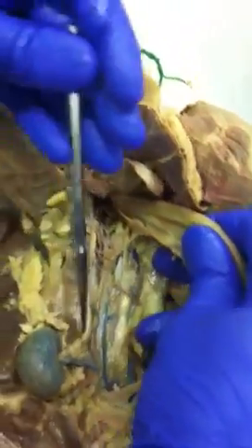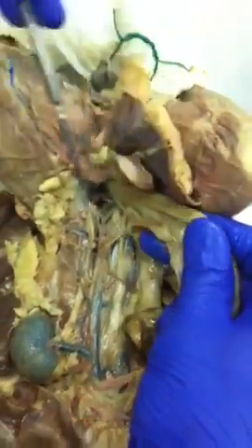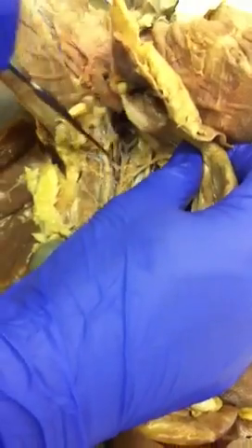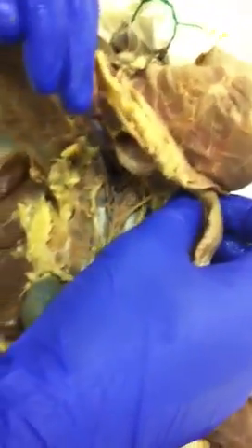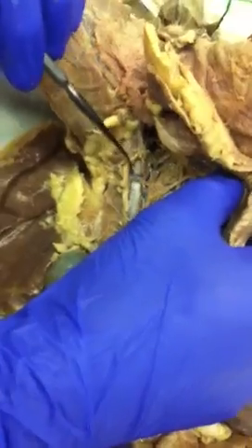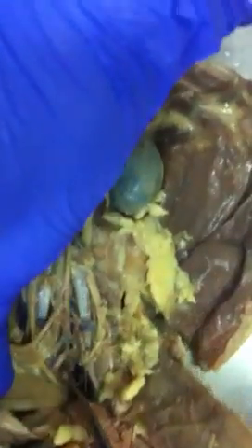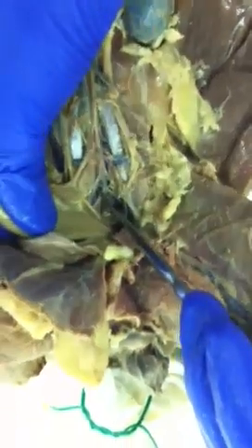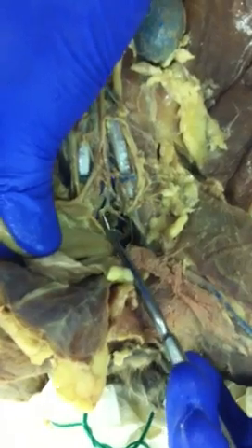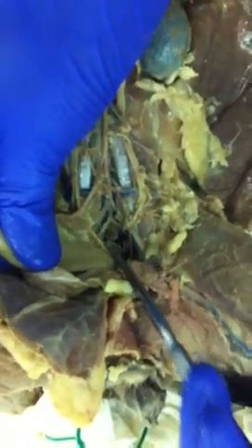Further down, so we had superior mesenteric. This would be inferior mesenteric, a smaller one. Around the lumbar spine, you have iliolumbar, artery and vein on each side. So there's a little bit of red there, and then the blue, both sides. And then you have the aorta splitting into the external and internal iliacs. So external is the top fork, this one, and internal is the smaller fork inside.